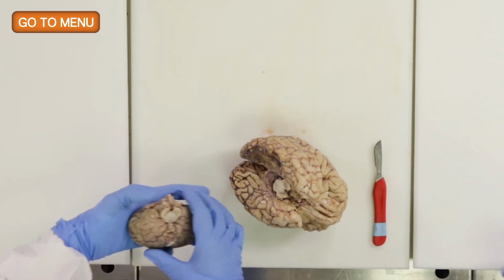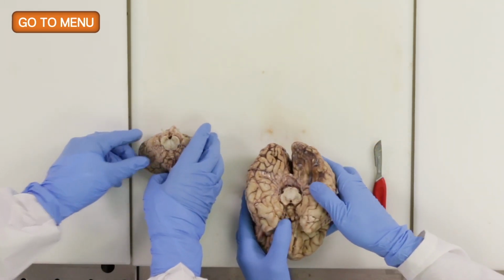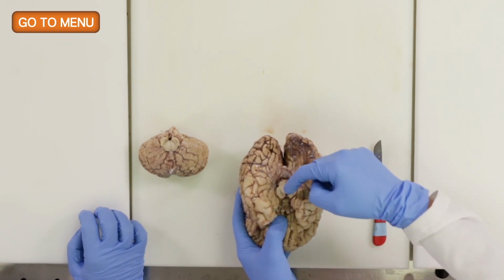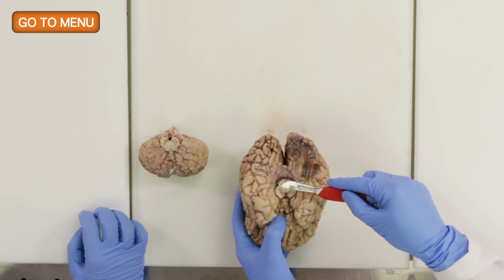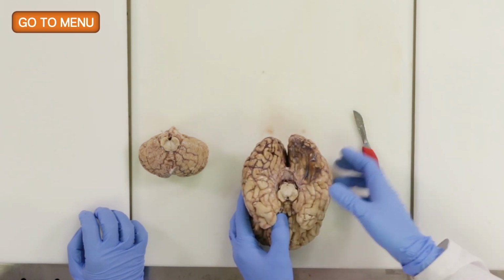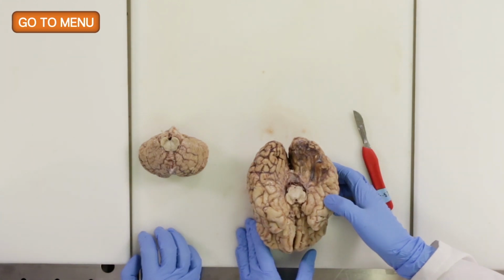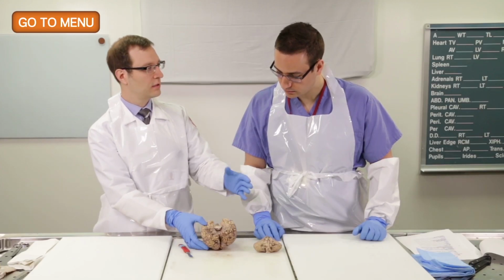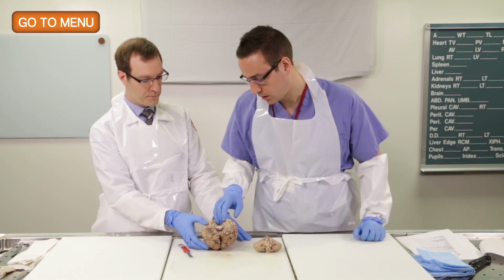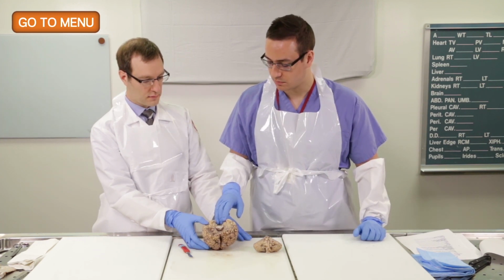Dr. Fulmer did. So as you can see here, this is the midbrain, and we can see the pigmented nuclei here, which are the substantia nigra. Okay, so we do want to take a look at the substantia nigra, and what's a common neurodegenerative condition where you might see alterations in the substantia nigra? So Parkinson's disease is one of the more common ones that comes to mind.